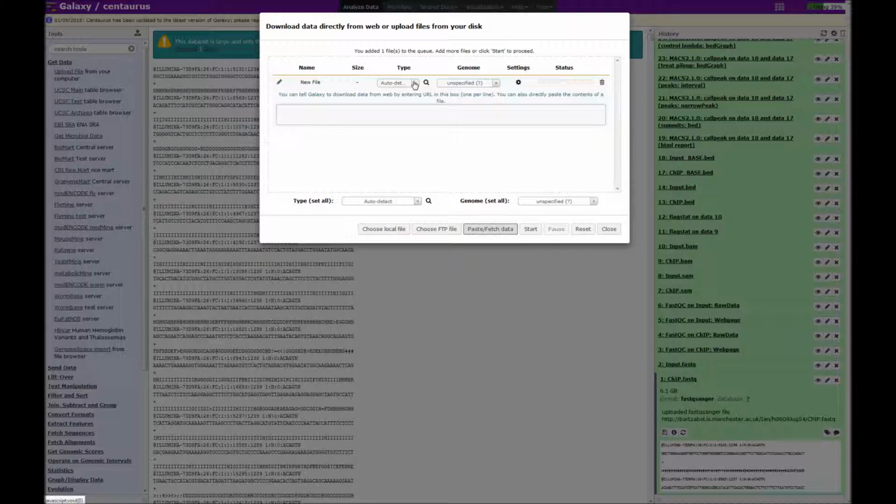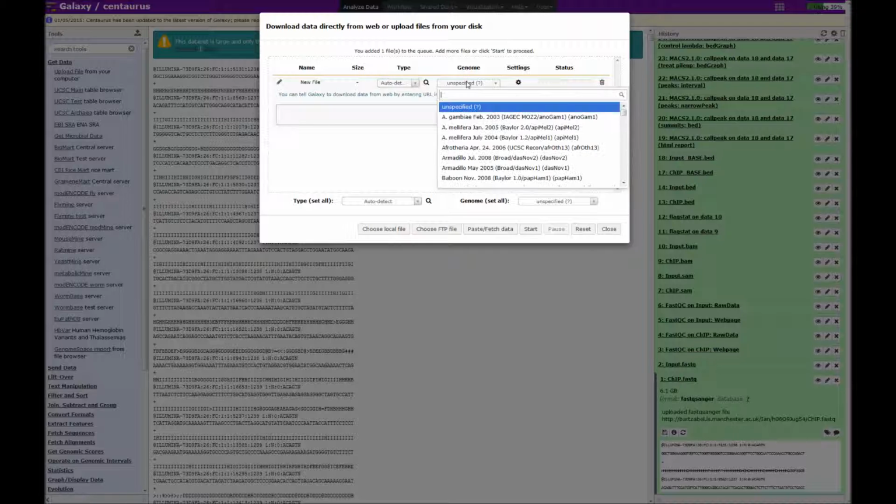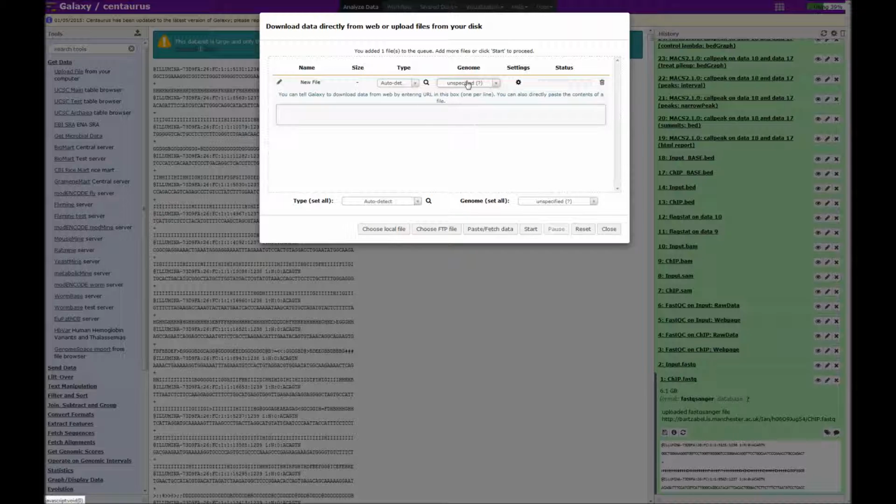So in this case, if we wanted to upload a fastq file, we'd click on here and you can actually start typing, so fastq. However, you do need to select fastq Sanger for it to be recognised by downstream programs. Now at the moment, because this is unmapped data, we don't need to fill in what the species or genome is, so we can leave this as unspecified.